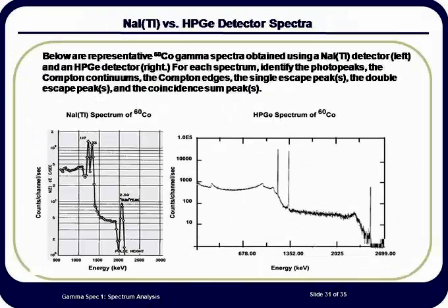For the right-hand spectrum, counted using a high-purity germanium detector, the separation between these same two peaks is 159 channels, and the full width half maximum of these peaks is about 1.5 keV. It is easy to see from the comparison of these two spectra that the sodium iodide detector would never be able to resolve other gamma rays if they were between the two cobalt-60 peaks.